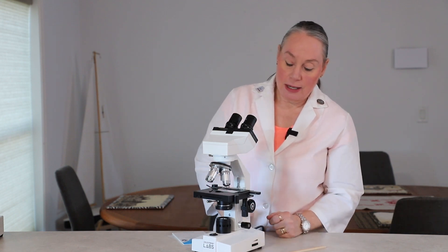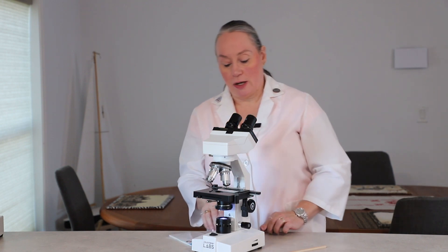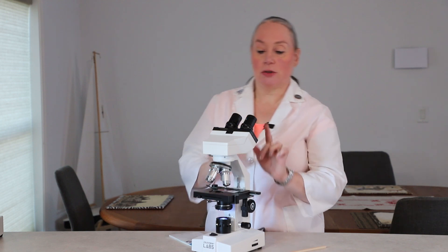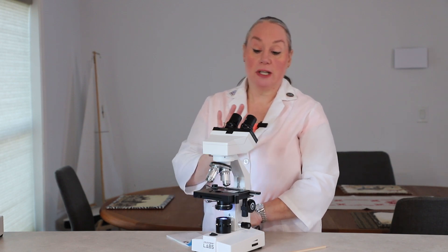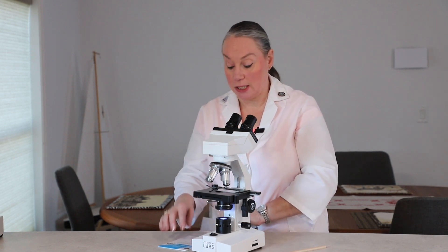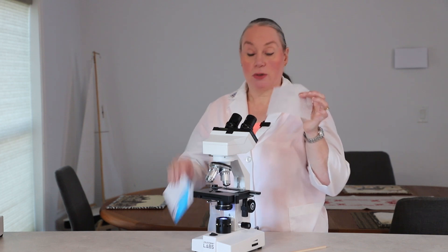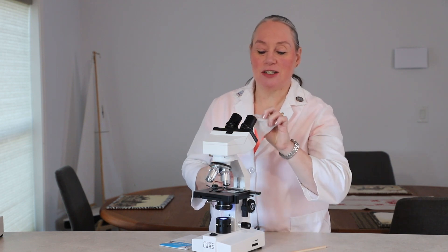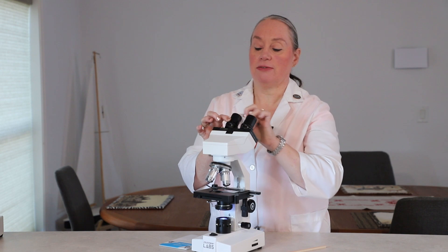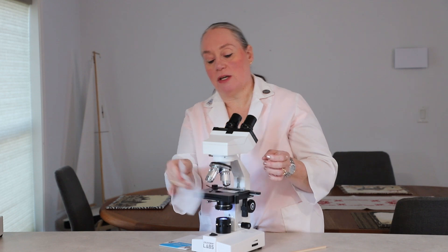So we've got our microscope here. Now let's get it ready to use. We'll turn on our light. Then we're going to take a look at the lenses to see if things are clean. If you kind of look in there and it's all smudgy and you feel like you need the lenses cleaned, you only use special optical lens paper that your teacher or instructor will have. Just gently use that to clean the lenses and get the dust off. As you clean each objective, it's just a little wipe underneath the objective.